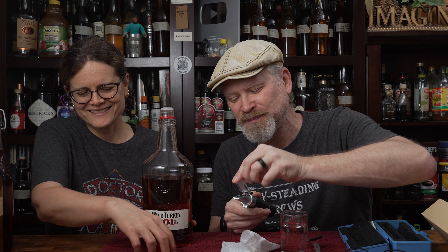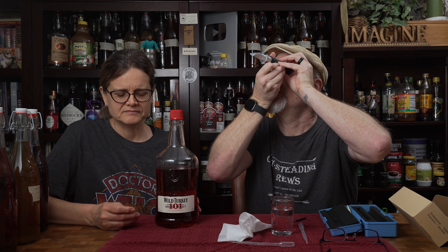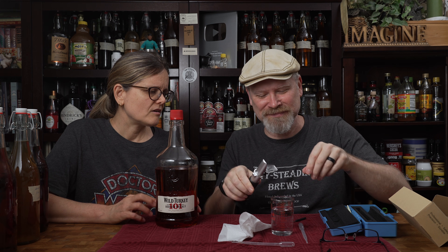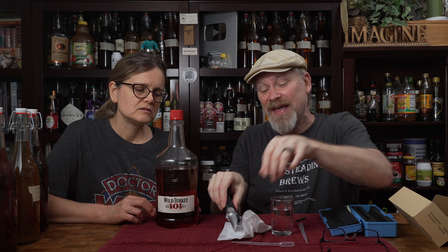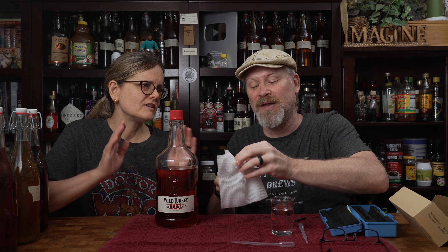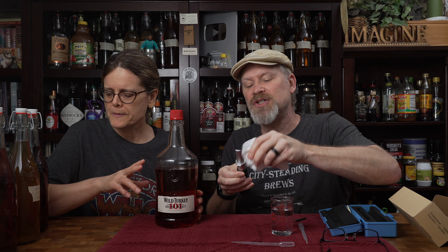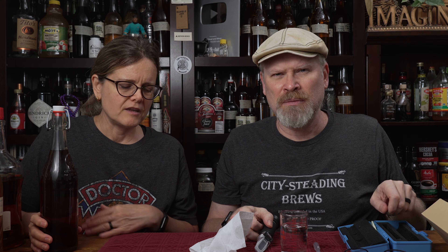A little for me. Okay, it's only reading 48 percent. To me I'm gonna call that close enough, I'm kind of okay with that. Are spirits allowed the two-point leeway like wine? I actually don't know what the rule is for that. What she's talking about is like with wine — if it says 12 it could be anywhere from 11 to 13 on the bottle, and the government is okay with that, it's within the range.